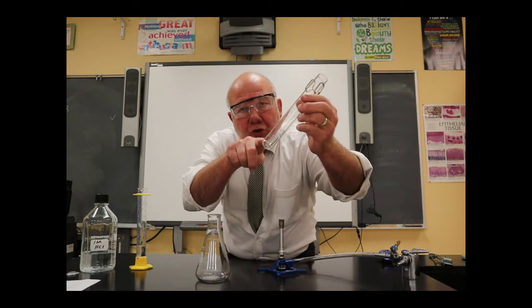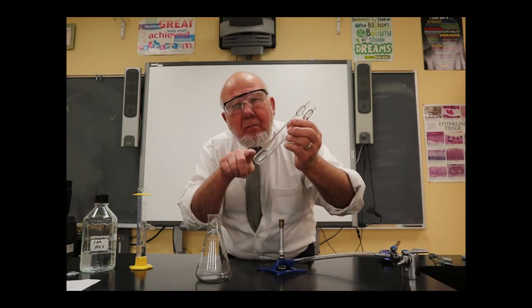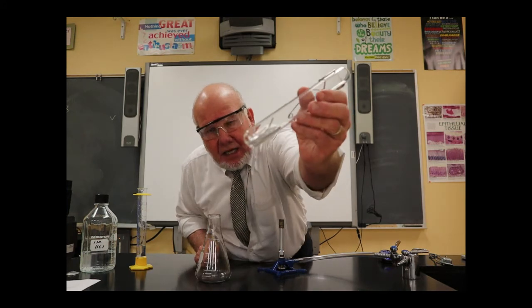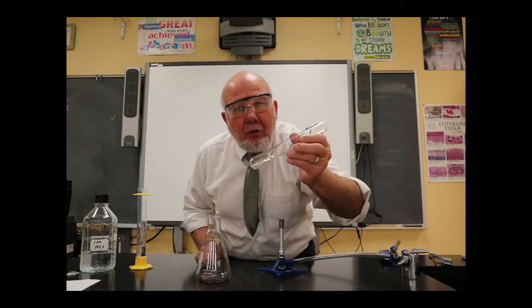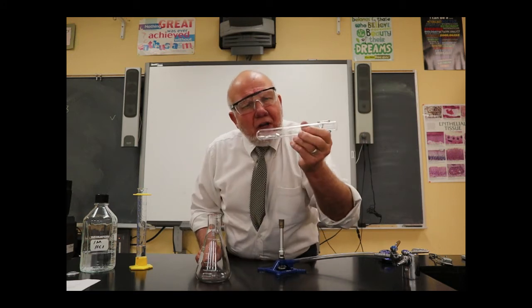I've massed 0.25 grams of the magnesium metal. I don't know if you can see it. It's a very silvery, shiny metal. And that's magnesium ribbon. 0.25 grams in here.